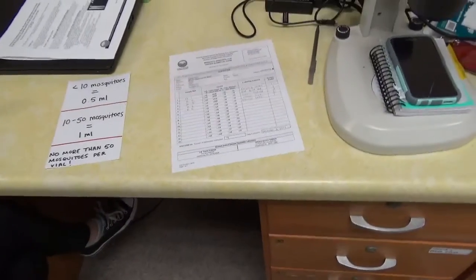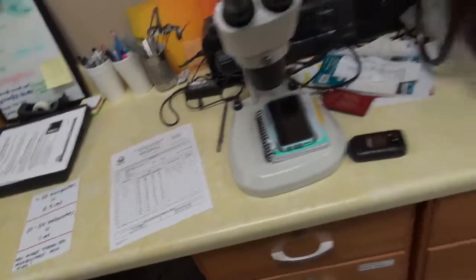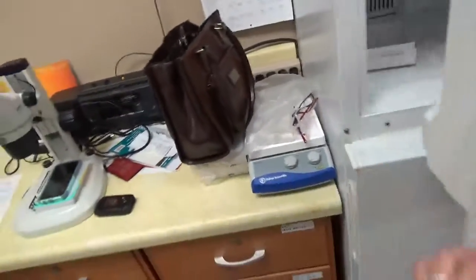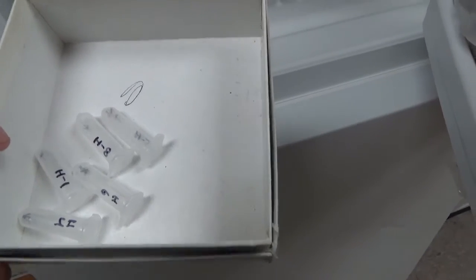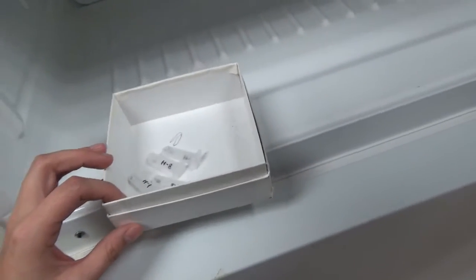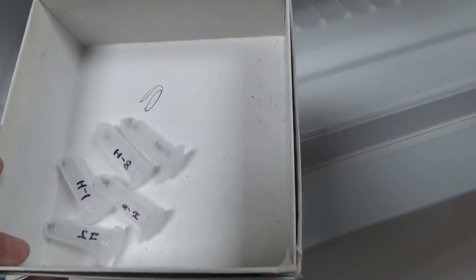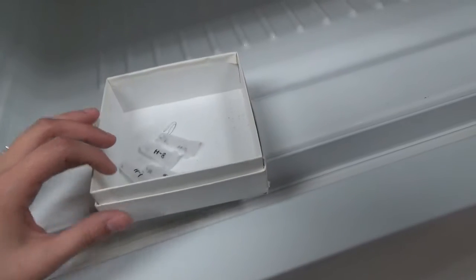first. They're typically going to be Aedes albopictus, but what I've done is set the vials in the freezer as I go and make sure they stay cool until you're completely done sampling. So if you want to process your Zika mosquitoes last, like I said, keep them in the vials in the freezer until you can put the solution in the vials.